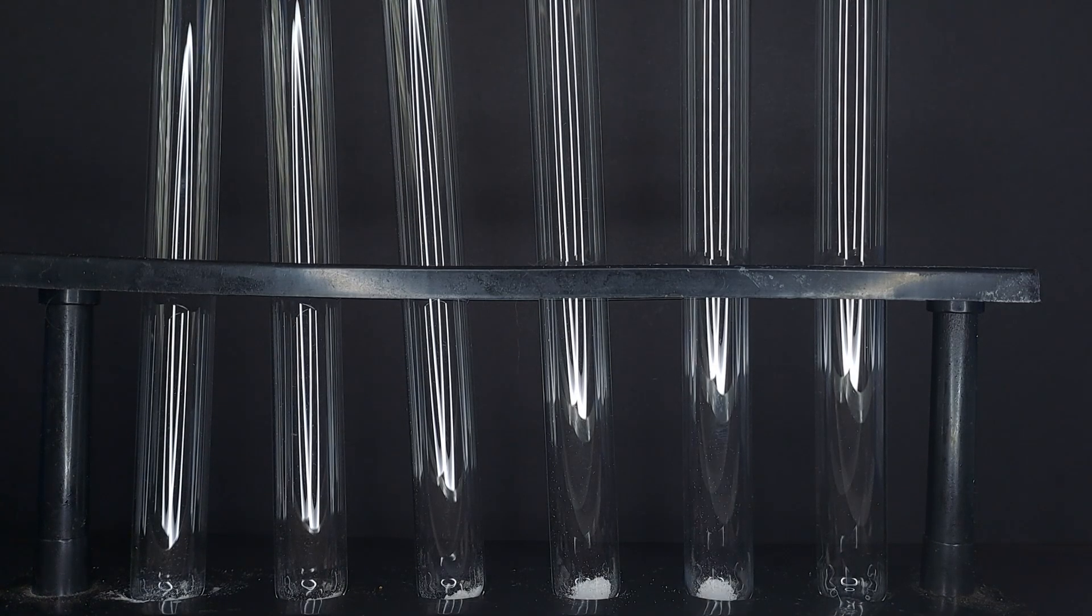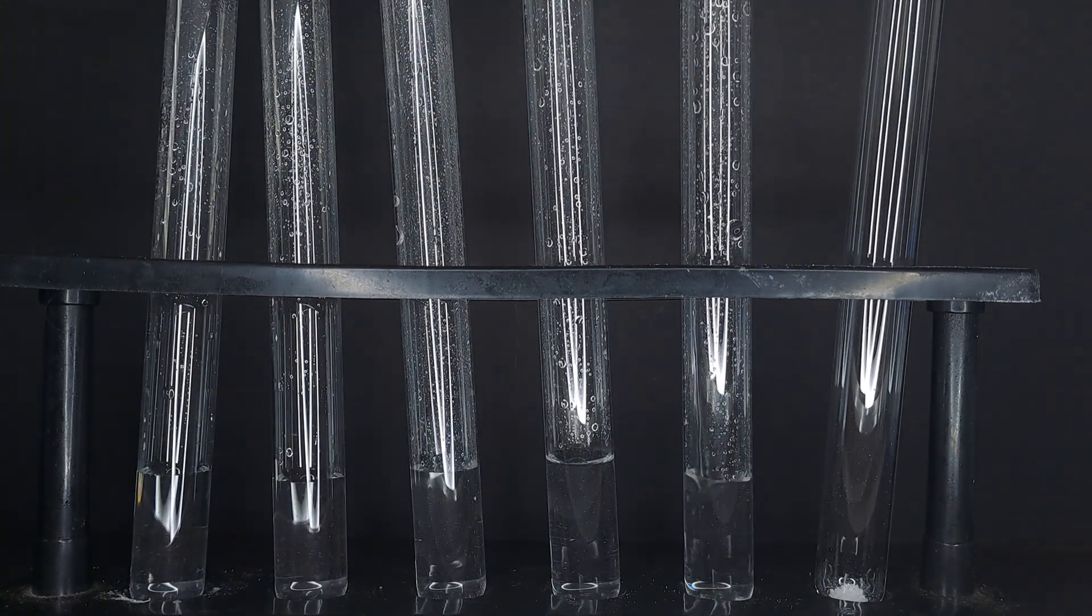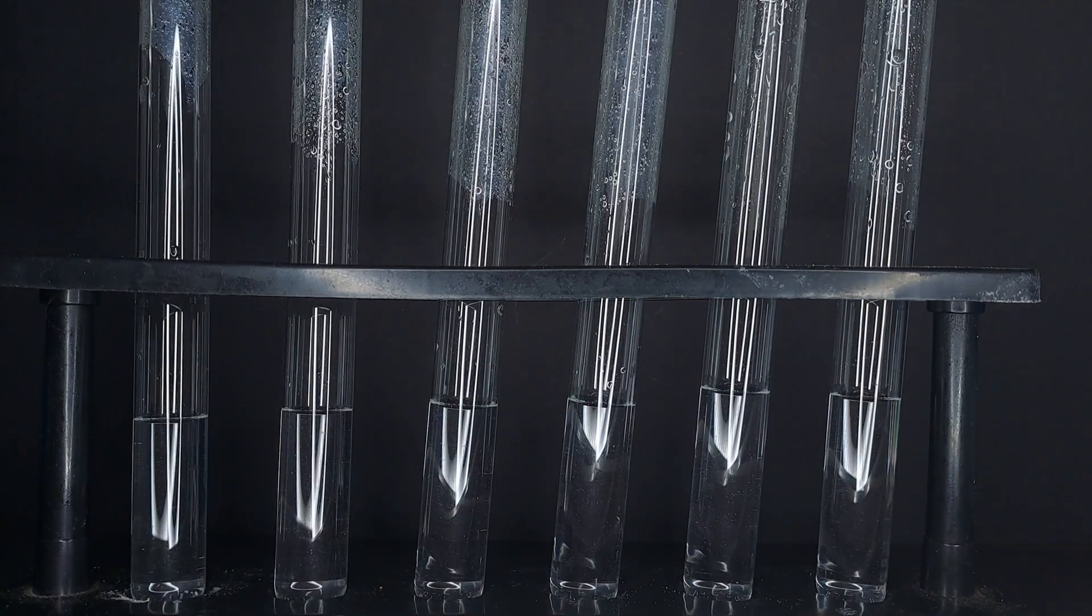First we prepare six thorium nitrate solutions using distilled water. Here's what happens in each one.